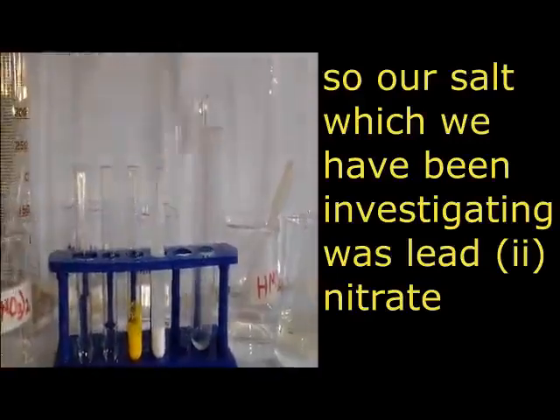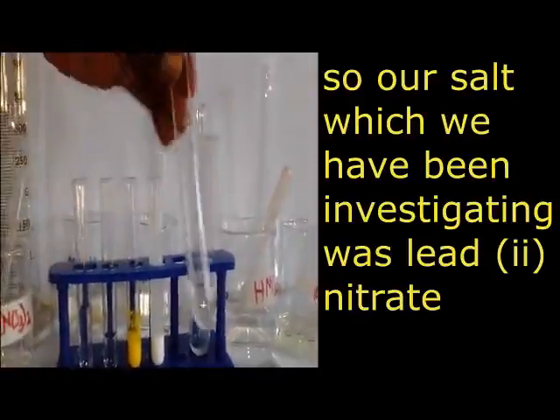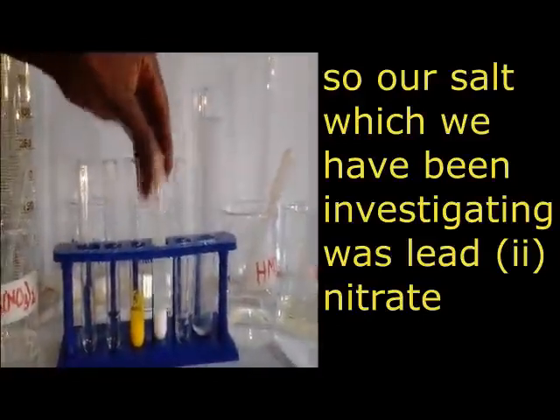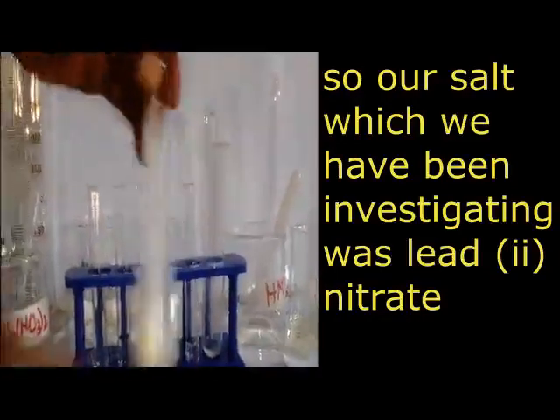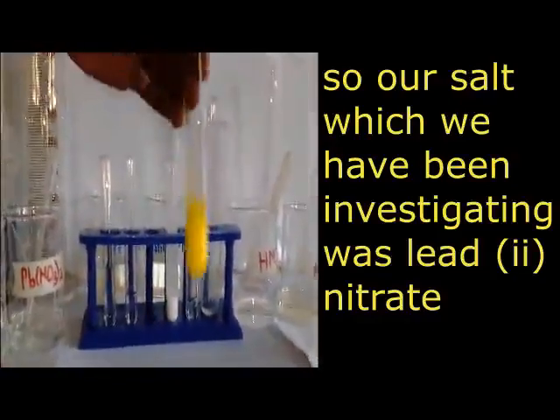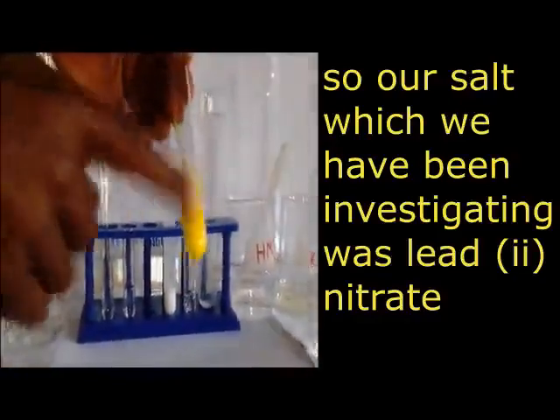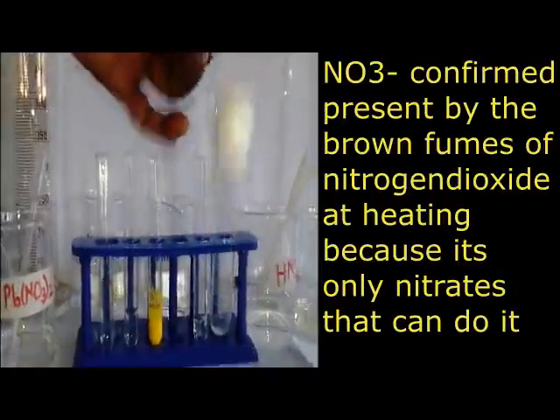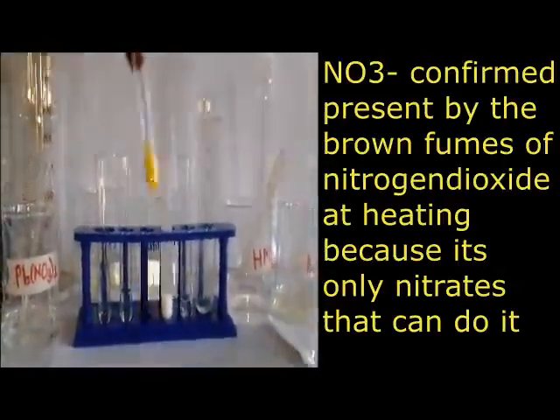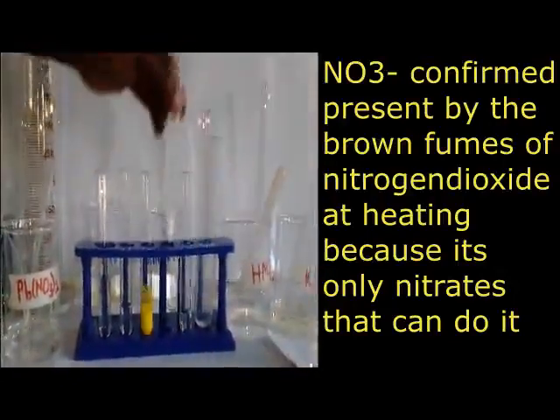Then we go to the third test, adding aqueous ammonia. We see a white precipitate insoluble in excess. Then we go to the test of adding potassium iodide. That is a yellow precipitate, which is a confirmed test for lead.